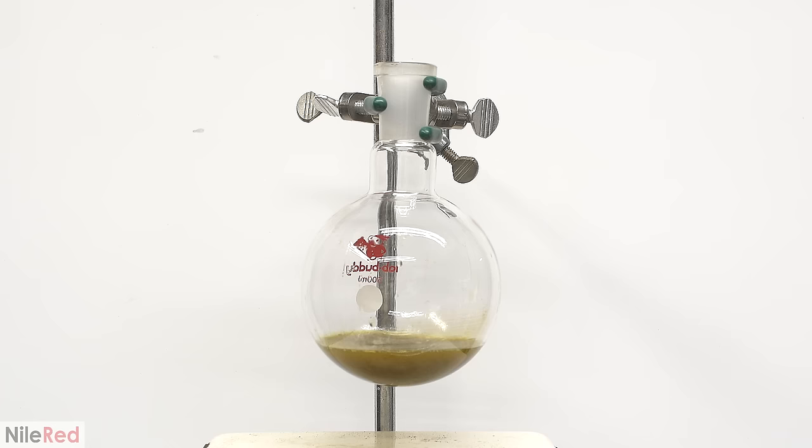The crystallization is also really slow and even once it gets to room temperature, no crystals formed. Only after 10 minutes did I see anything start to form. The start of this time lapse is about 30 minutes after it already cooled to room temperature. The time lapse was taken over about an hour and a half, so in total it took around 2 hours for most of the crystals to form.